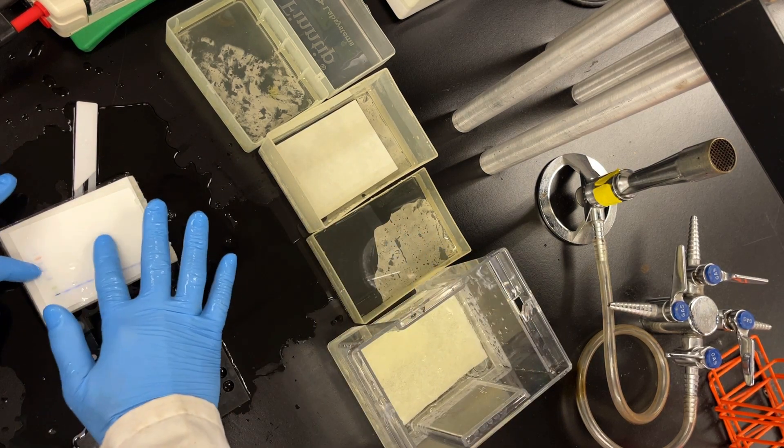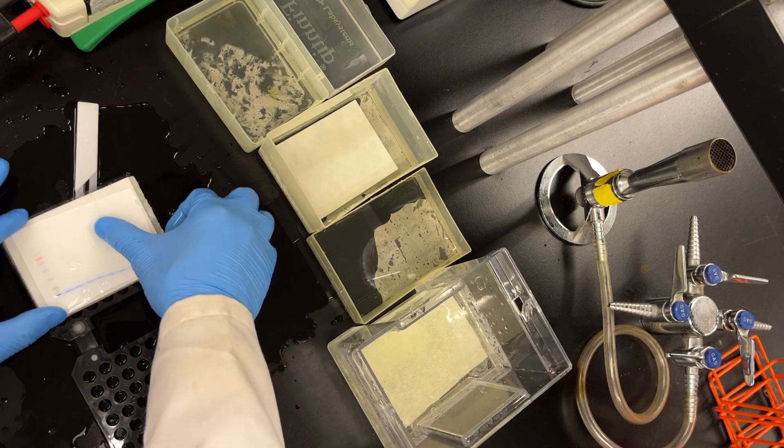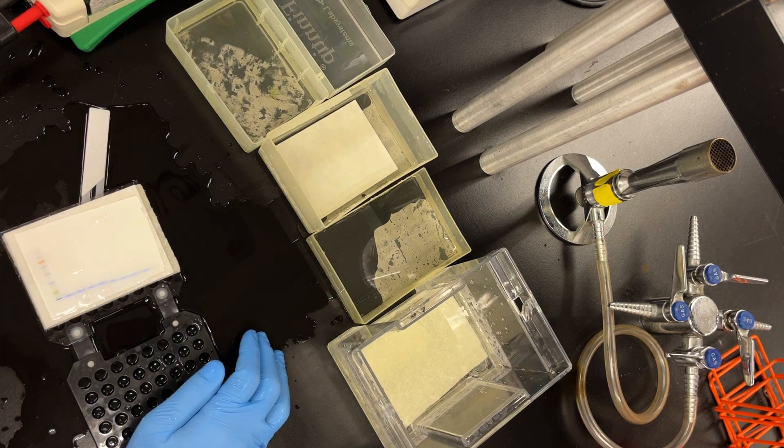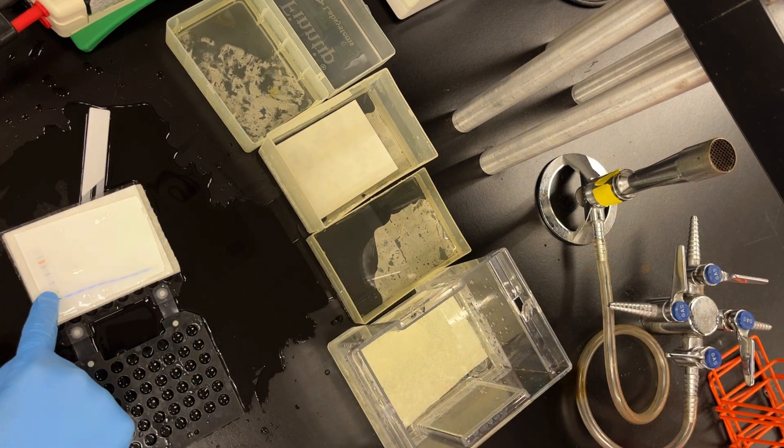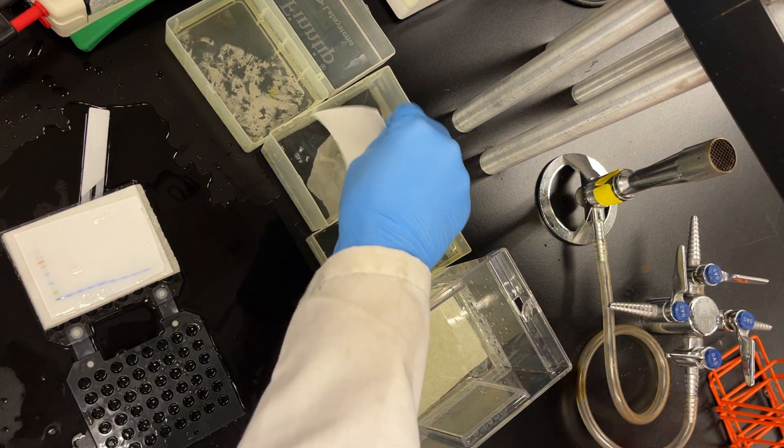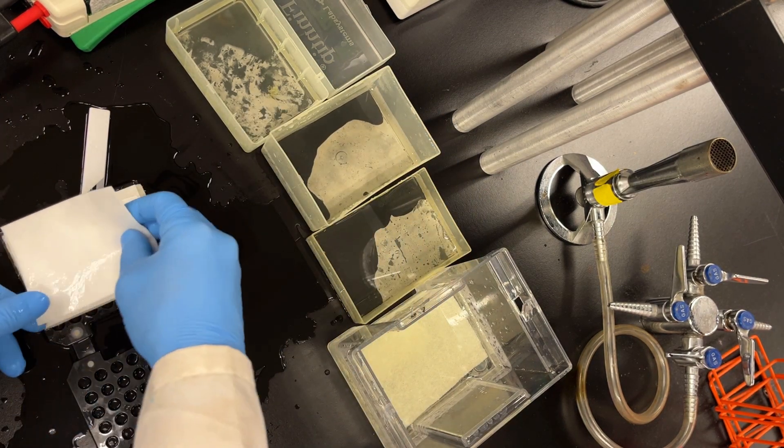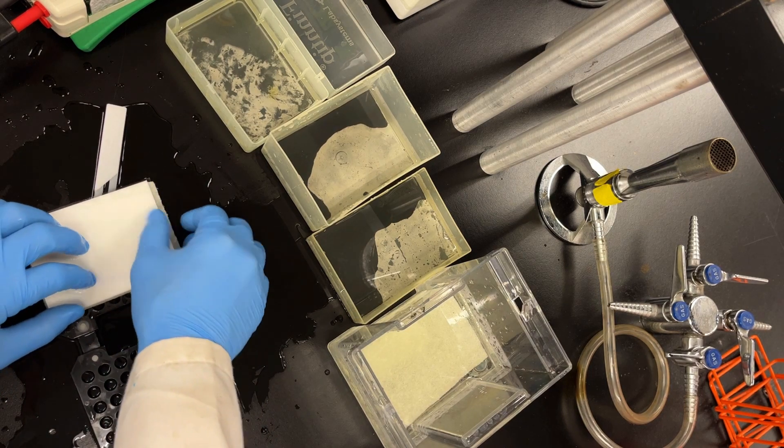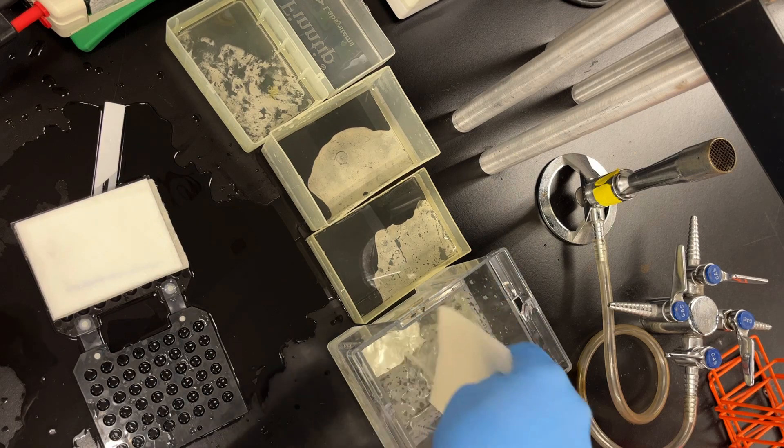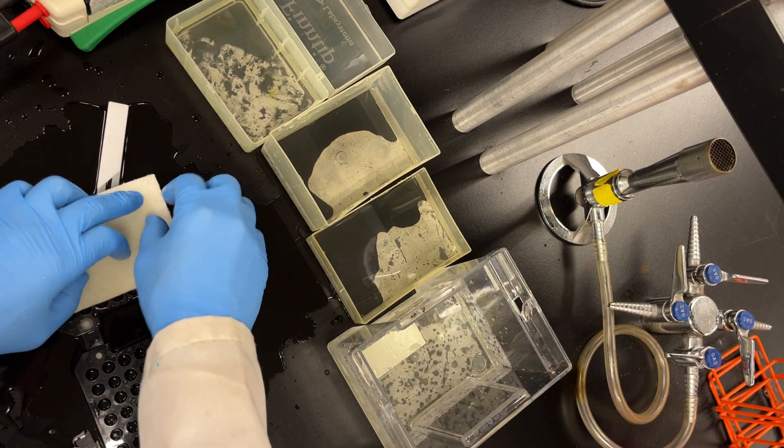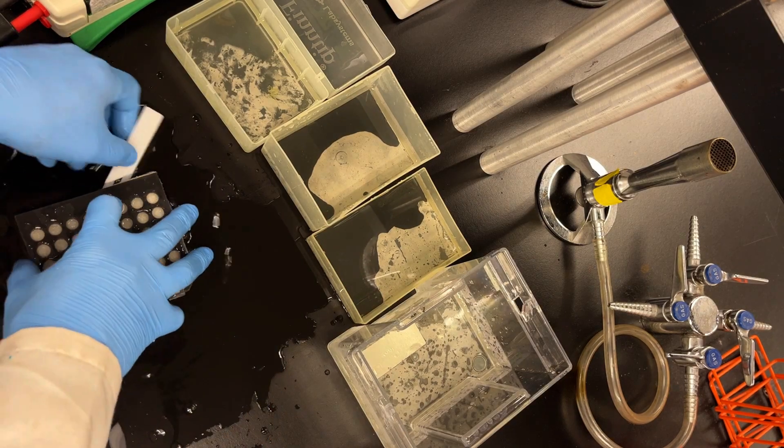The idea is that the electrophoresis is simply going to transfer the protein from the gel onto the membrane that binds protein. So there we go. Did my best. Made sure that I have everything in the order that I want. And now we're going to finish it off. A little bit of transfer buffer, nice and wet. Put my filter paper down. I'm going to finish it off with my sponge. Dribble a little transfer buffer. And close her up.